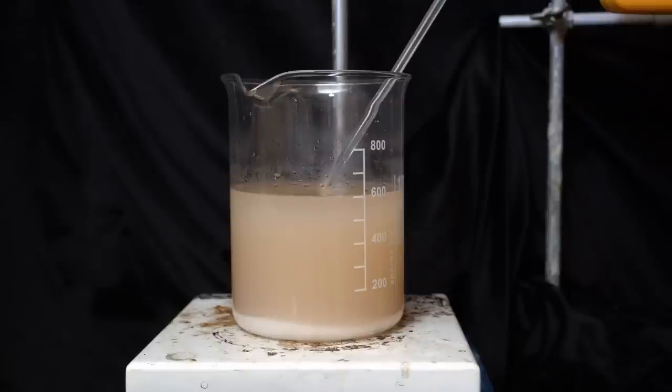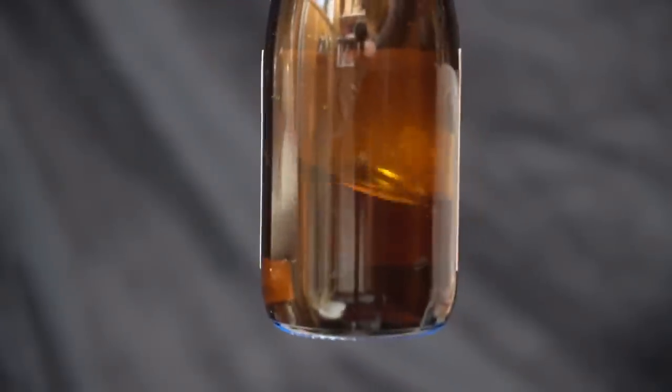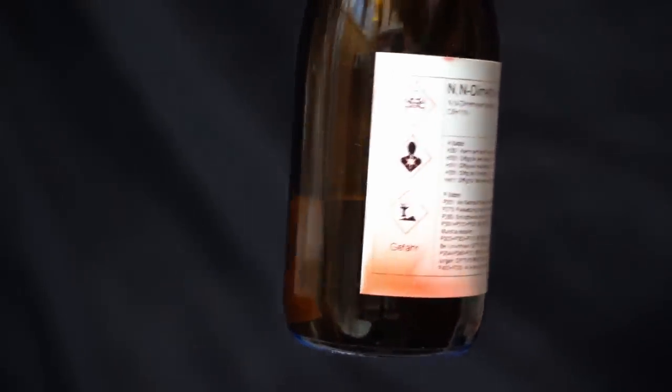There's a good chance that there might still be product in the aqueous phase, but I'm not going to run another extraction. All in all, this was a successful synthesis and I have enough dimethylaniline for the last part of this project where we'll be making methyl orange and some other dyes as well. Until then, I wish you all a pleasant day and stay tuned.